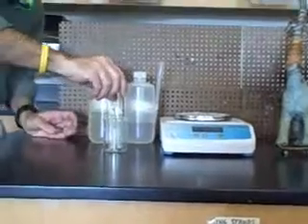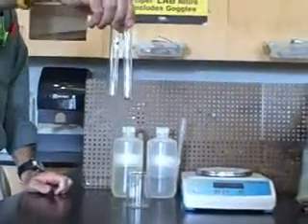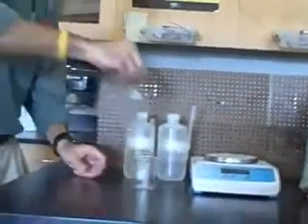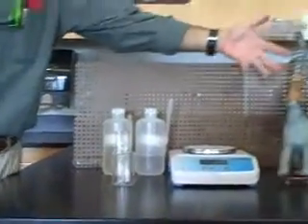So over here, I've got two test tubes, a beaker, I have two liquids, I've got a balance, and we have our demo dino, of course, on our little tech deck.